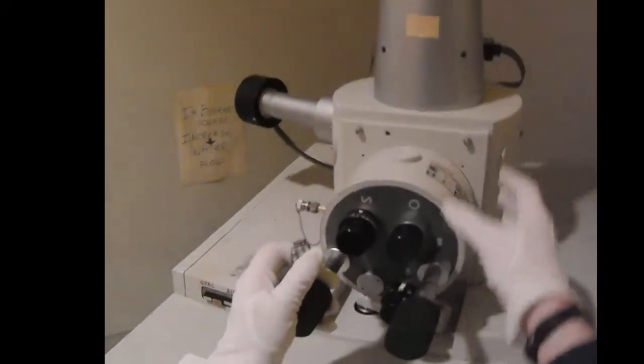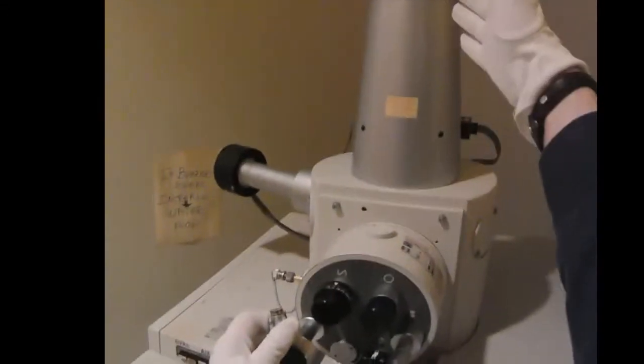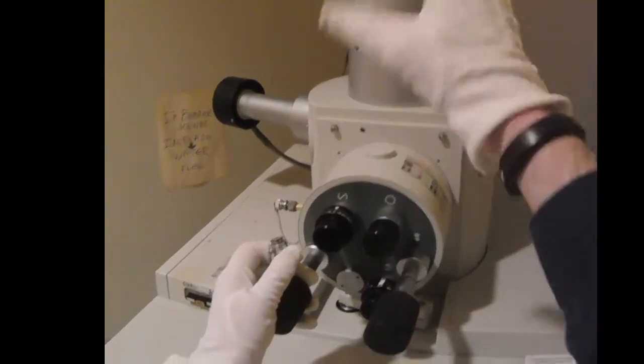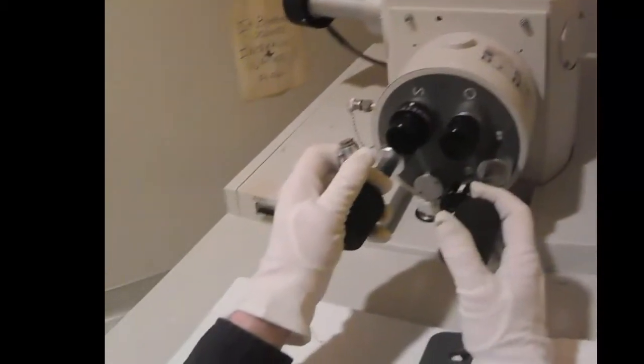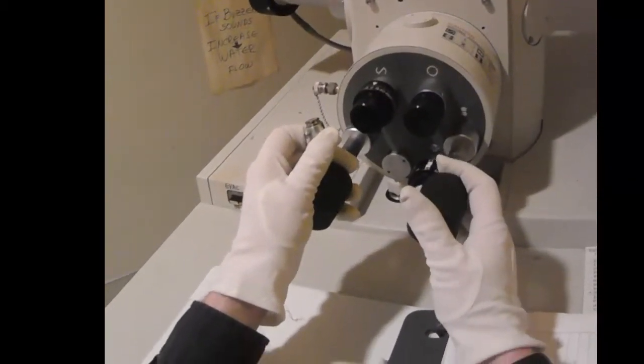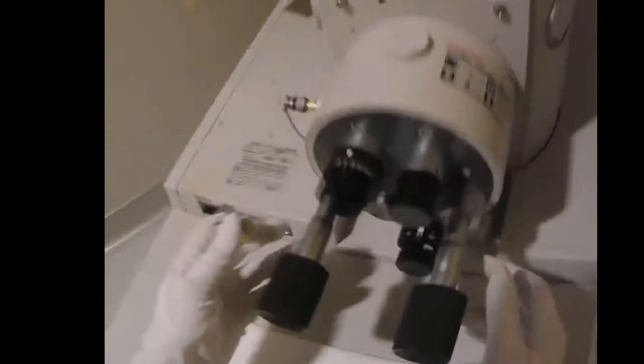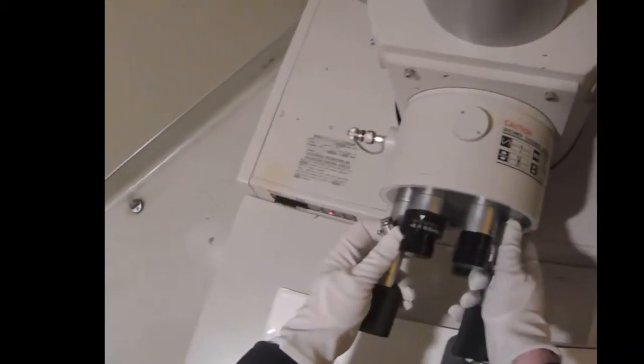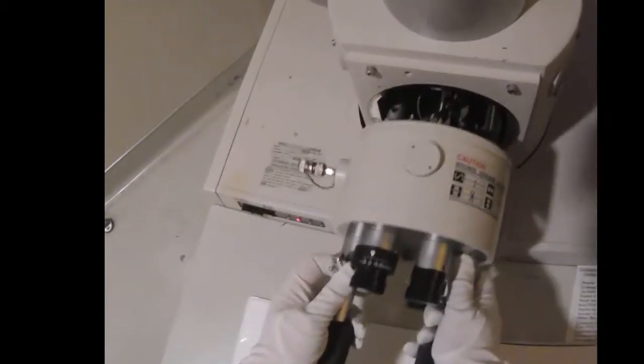Because we're opening this whole column to air. And this is important that this column operate under high vacuum. So we want to be careful to not leave this open to air. So I gently pull.